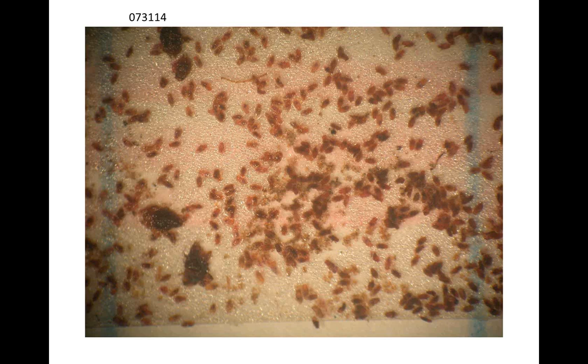But I didn't have any problem, not keeping a plastic sheet over them, because I kept a piece of wax paper over the top of the stack. Every week I just took the new pages with the tapes and laid them right on top of the previous week's pages, and then kept a piece of wax paper over the top to keep the dust off. And as you can see, I took that picture this morning, and the traps were collected last July. So you could actually still count that.